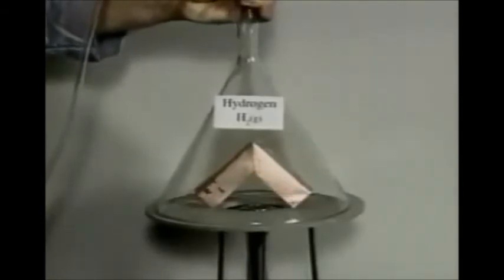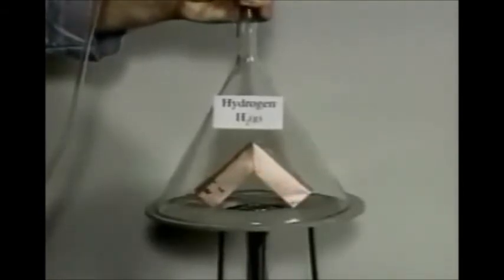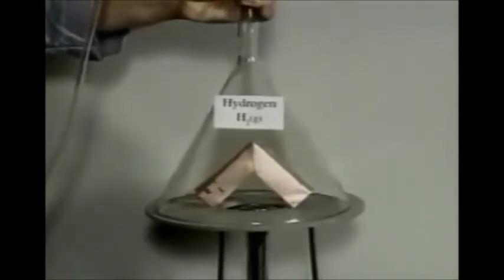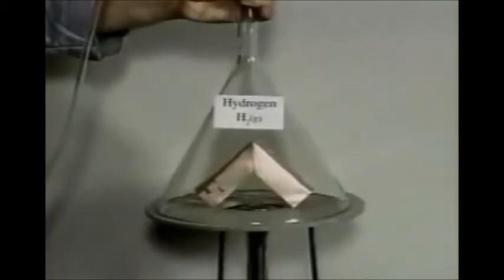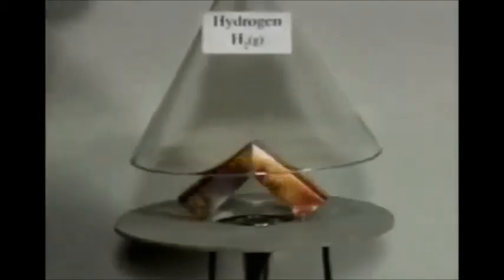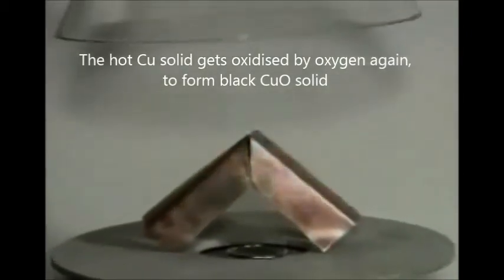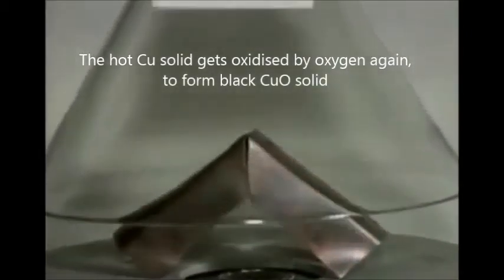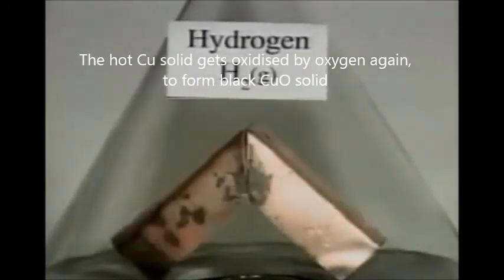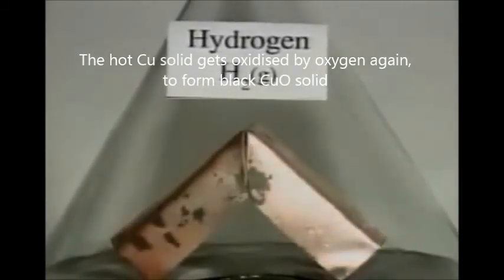The dark color disappears, leaving a pure copper color. Oxidation and reduction of the copper can be repeated several times by removing and replacing the funnel, until the metal cools and the reactions slow down.